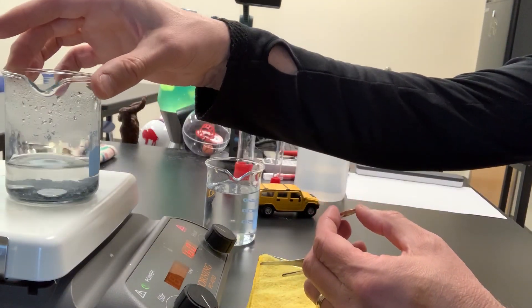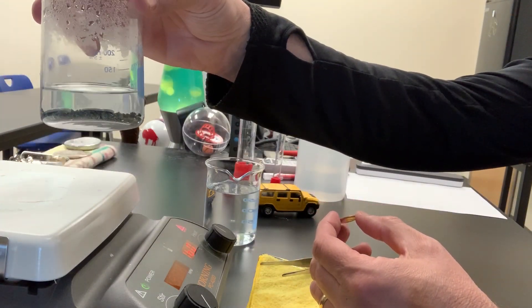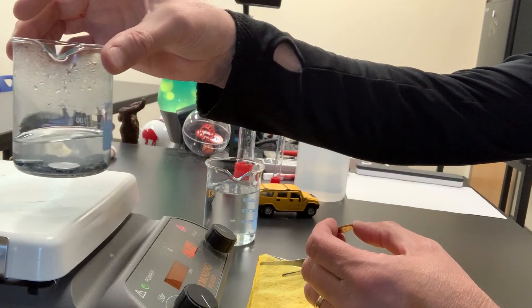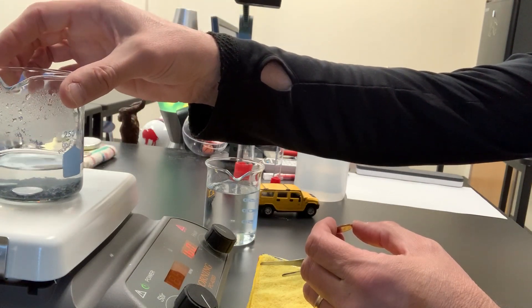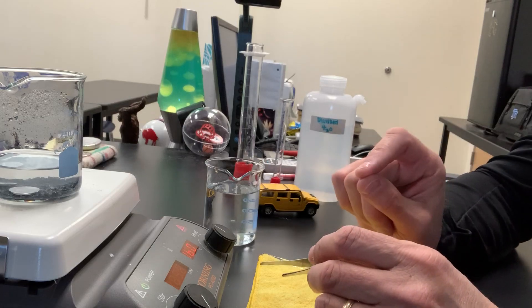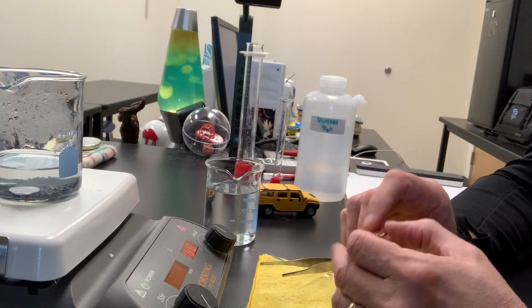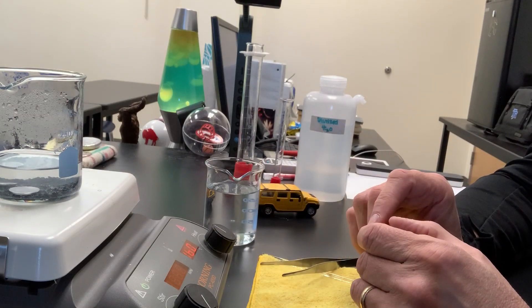In this beaker I have some zinc in the bottom and a little bit of sodium hydroxide solution, and I'm warming that up right now. There's actually two pennies in there now because I'm cheating a little bit on the timing of this video. You'll see why in just a second.